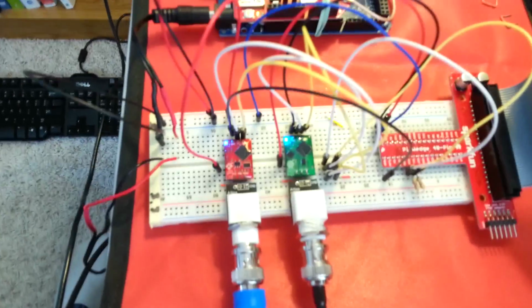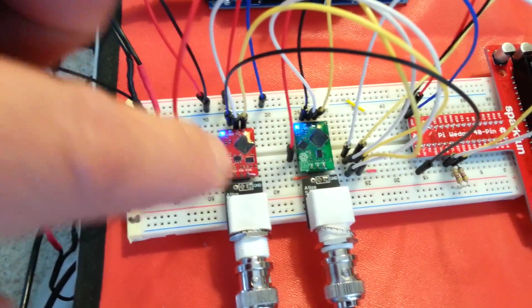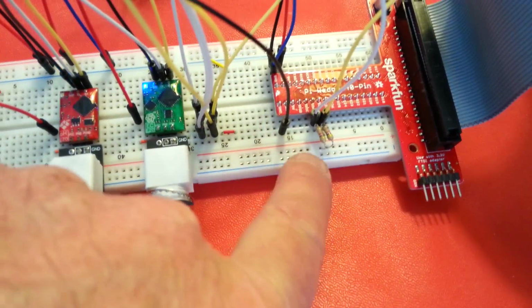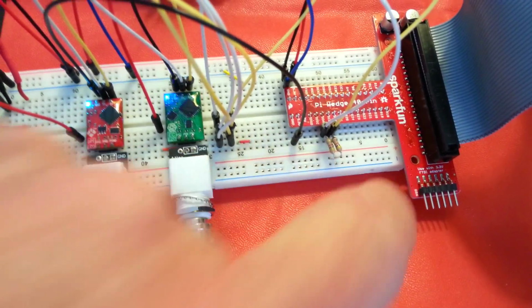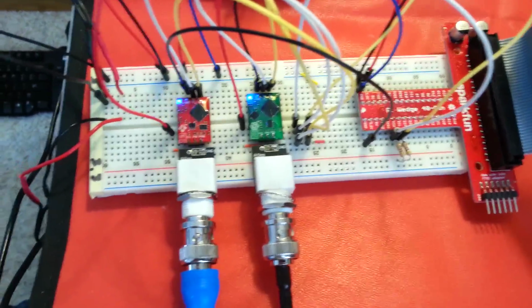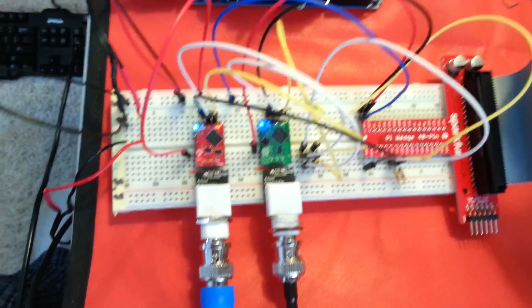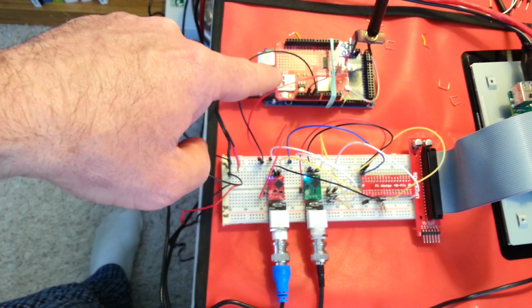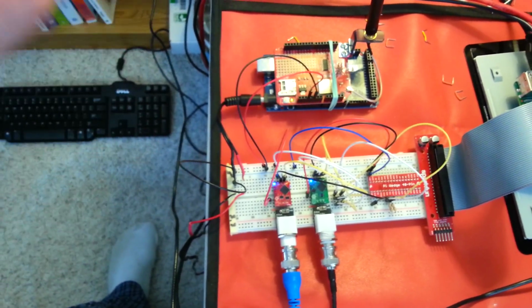I ran into a problem. Well, first off, you can see that both sensors, both circuits are reading with the flashing lights there. And to back up a little bit, I did put some external pull-up resistors in while I was troubleshooting. I had some trouble with the connections. As it turns out, I forgot to tie the ground from the Pi being used as a power source and the Arduino being used as a separate, isolated power source, but they do have to have their grounds tied.